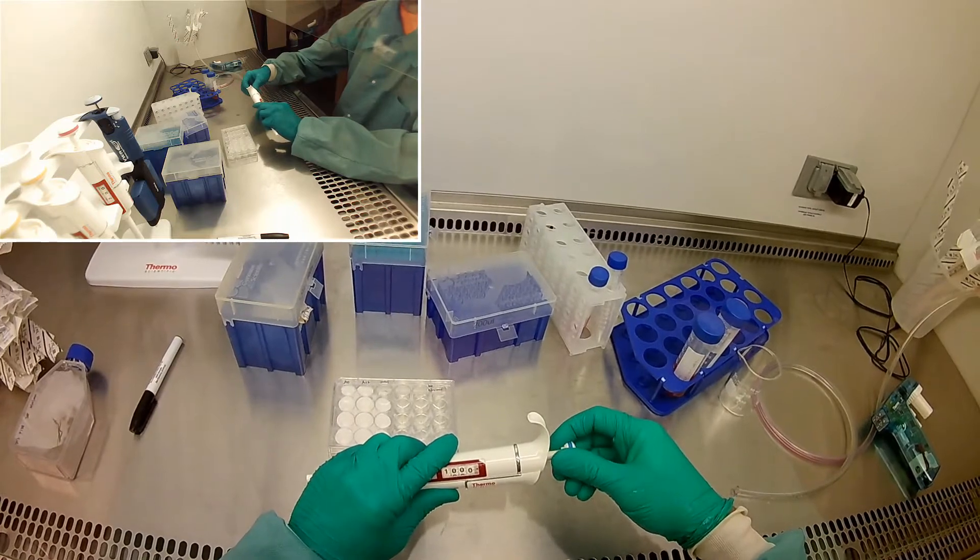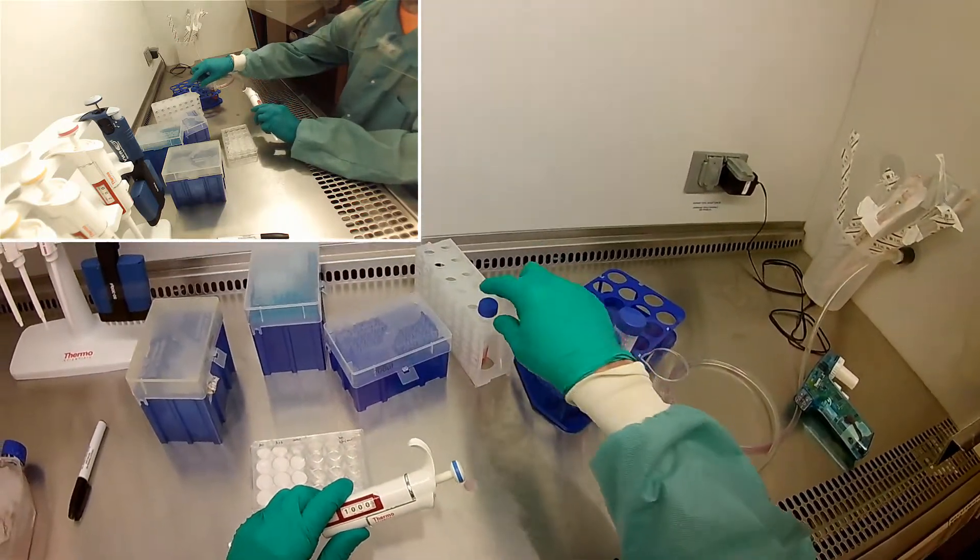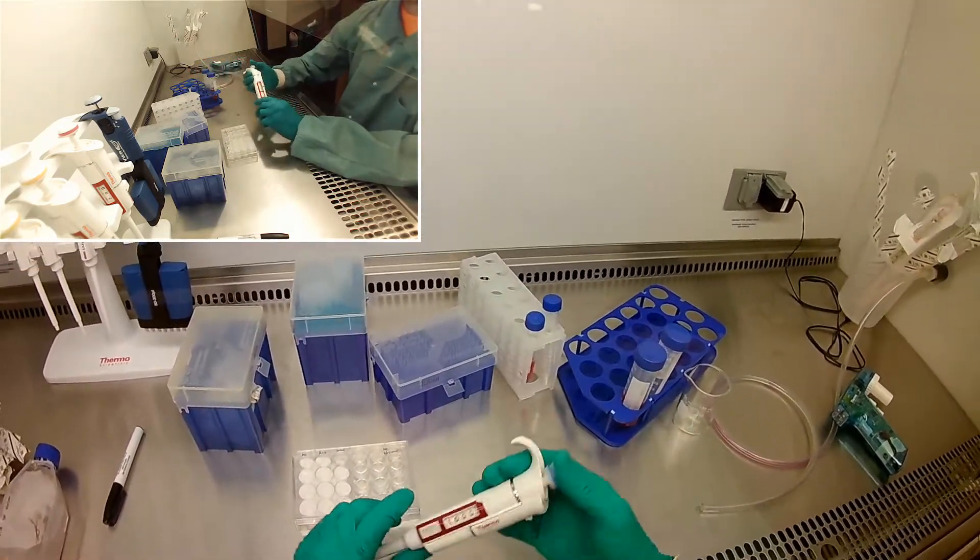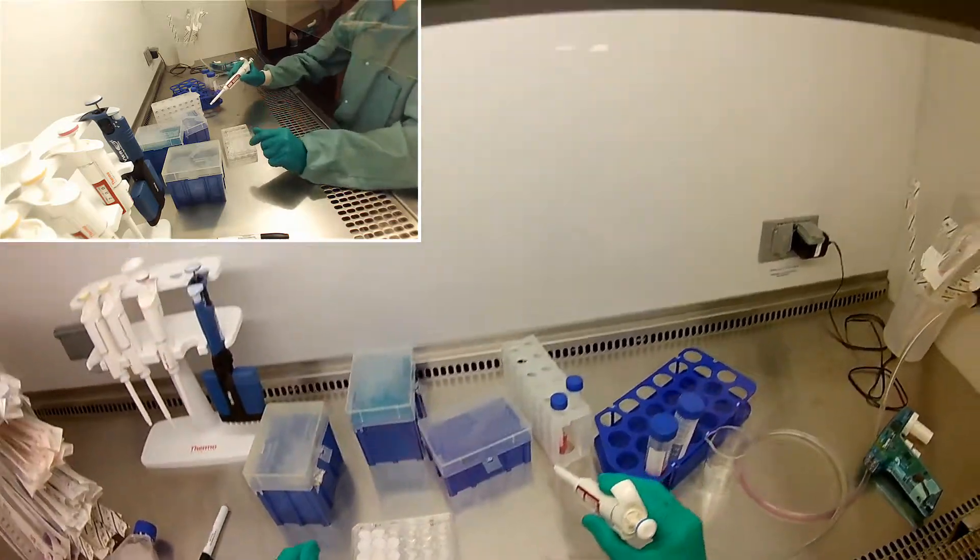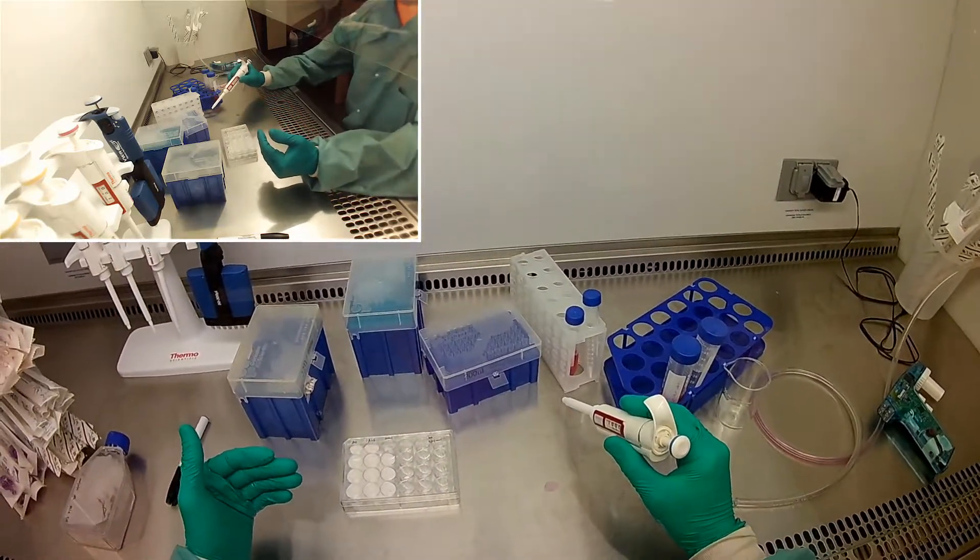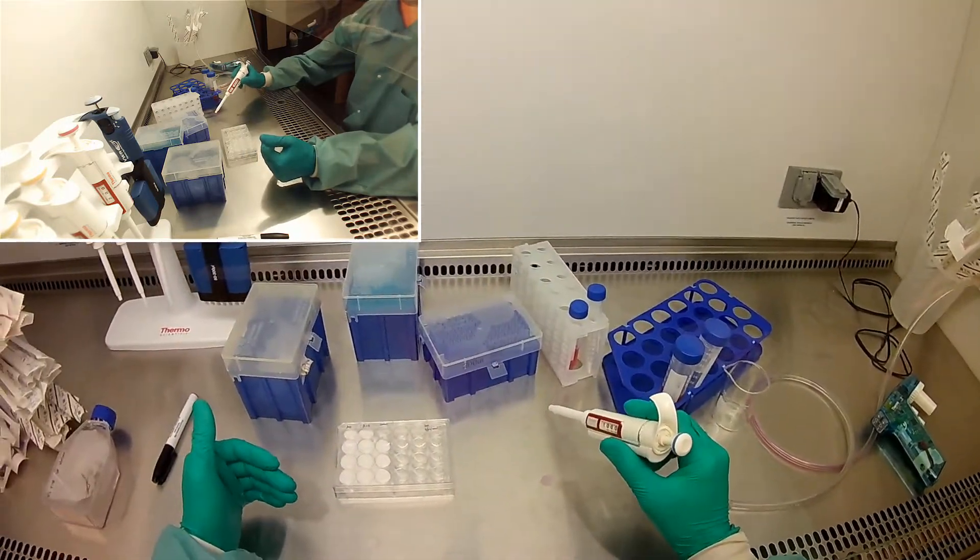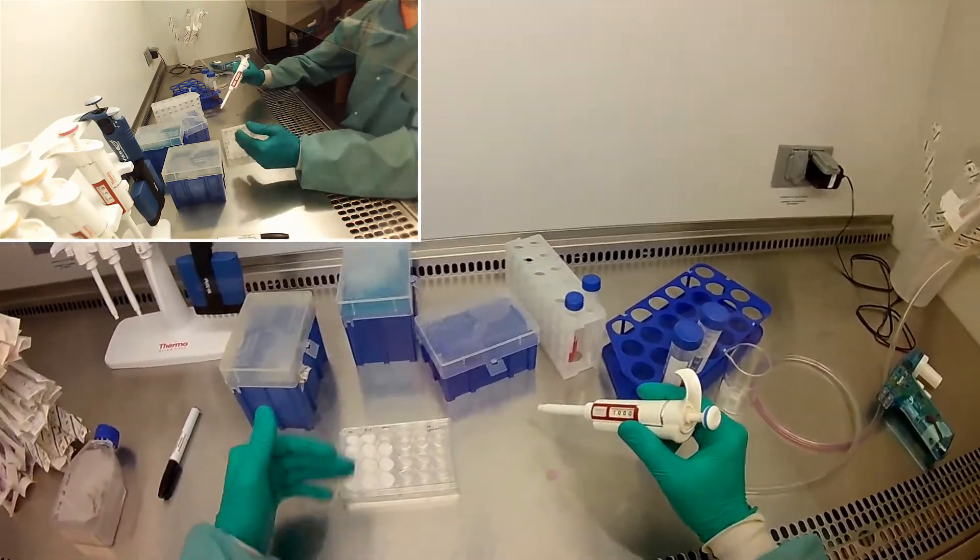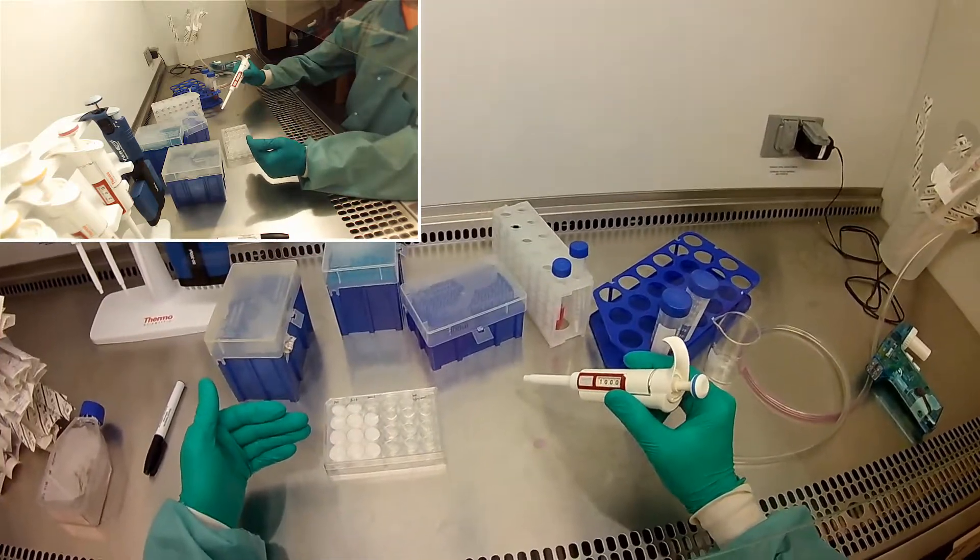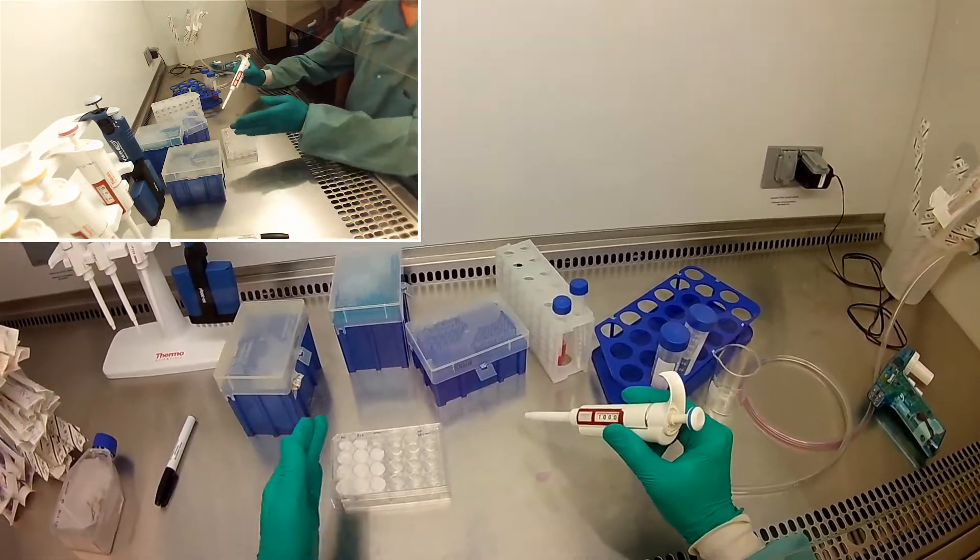So if I need 150,000 cells, I calculated based on my count that it's about one mil. And so when I counted, it wasn't exactly 150,000 cells. It was like 145,000, I think. And I'm just not going to be like, we don't care if we seed an exact number. We just need them to be all the same so we can compare.